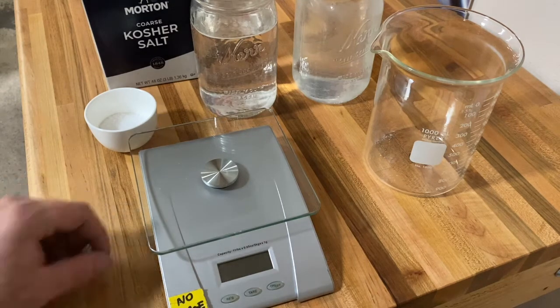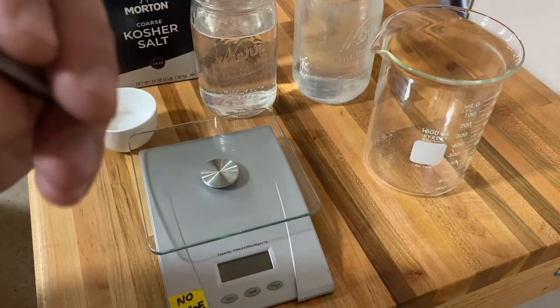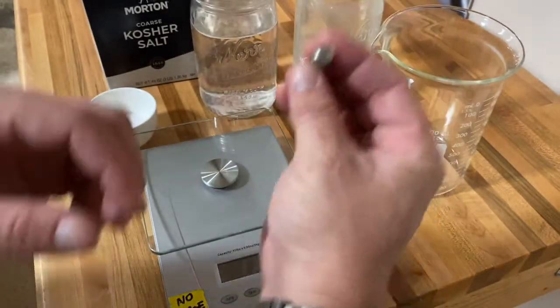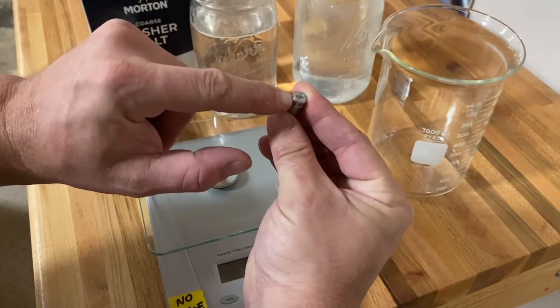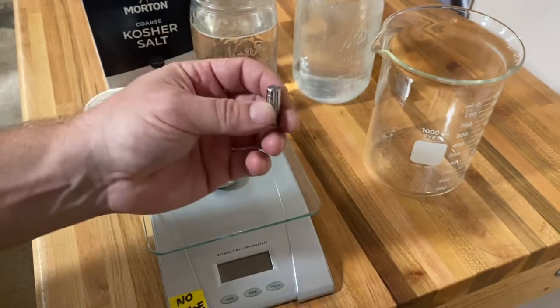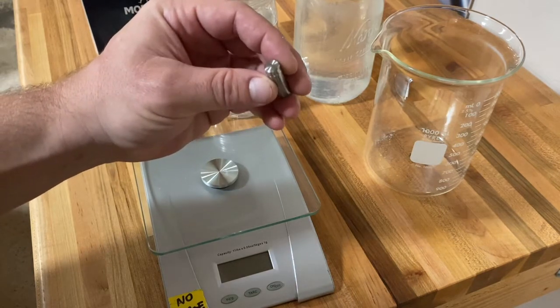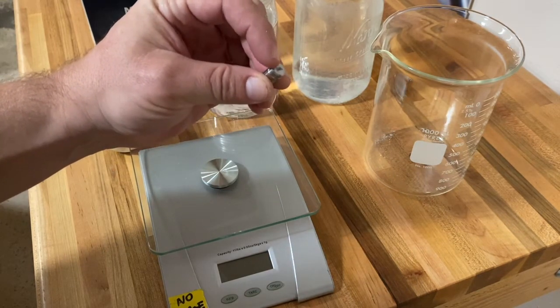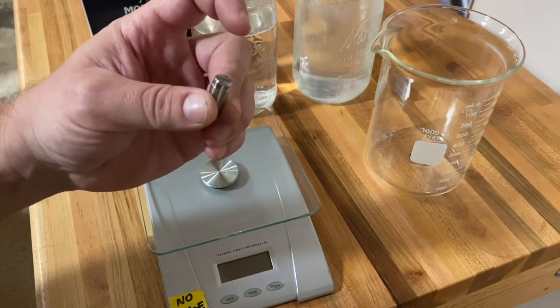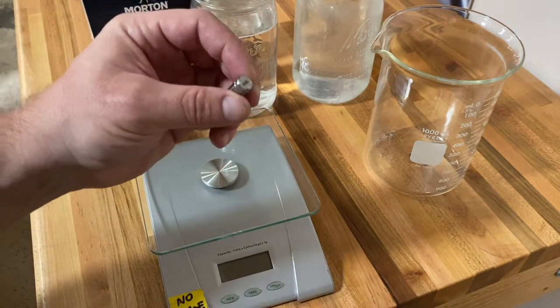Going to do a quick video here to find out if our laser process is bringing unalloyed iron to the surface. When we do our deep engraving on 316L parts, there's obviously iron alloyed in the 316, and we want to find out if something about that process is leaving a thin layer of unalloyed iron in the marked area that could essentially rust when it comes in contact with salt water and show up as surface contamination.